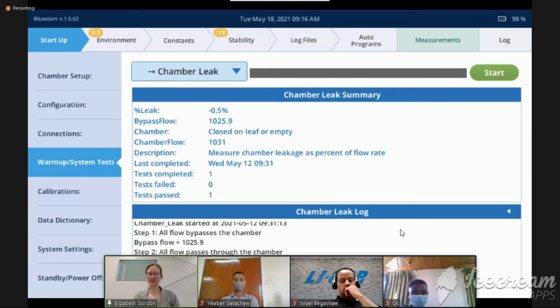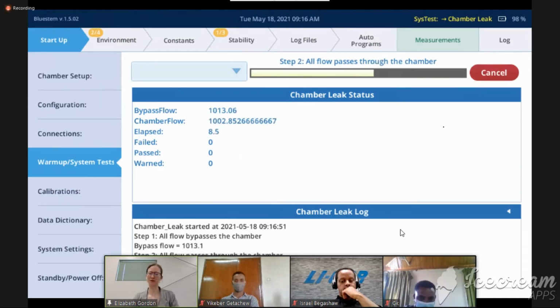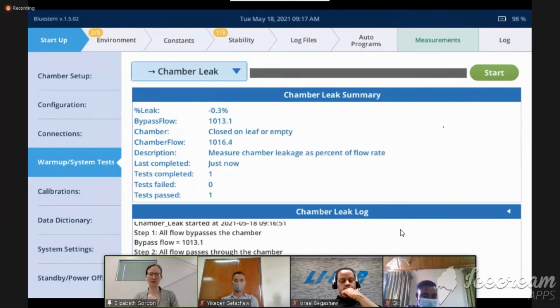Chamber leak is exactly what it sounds like. It's another test related to how the chamber is leaking. Most chambers are not very leaky. We don't want them to be, but there's always a little bit. And so we just find out if there is a bit of a leak, what is it? So I have a 0.3% leak. I'm not worried about a 0.3% leak.